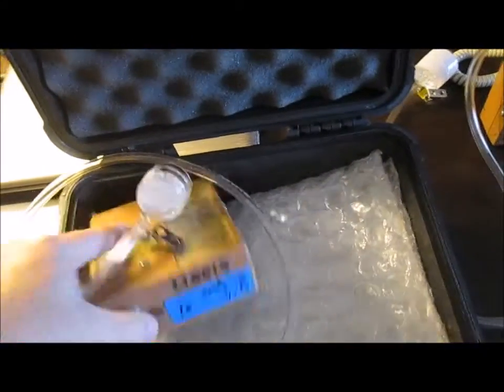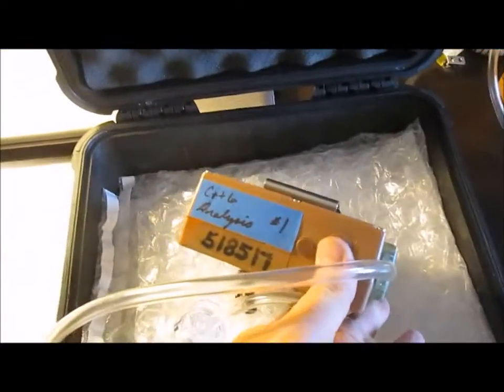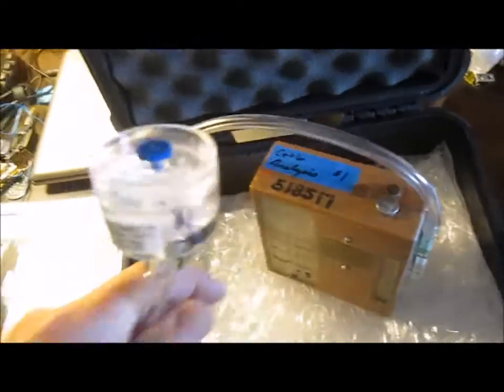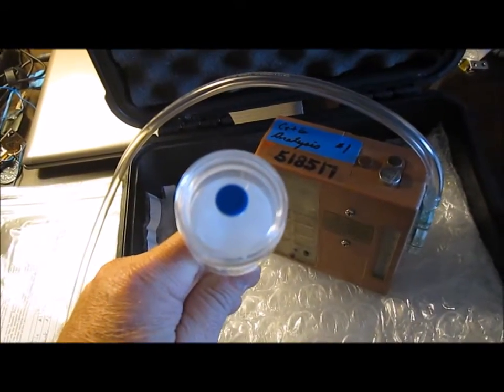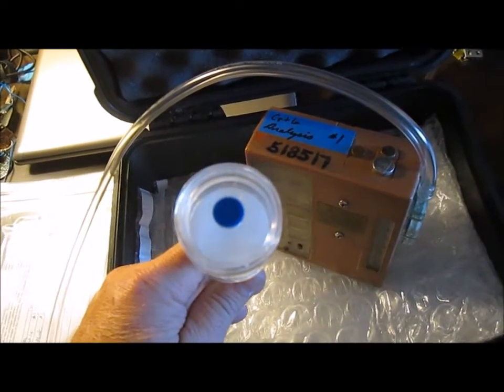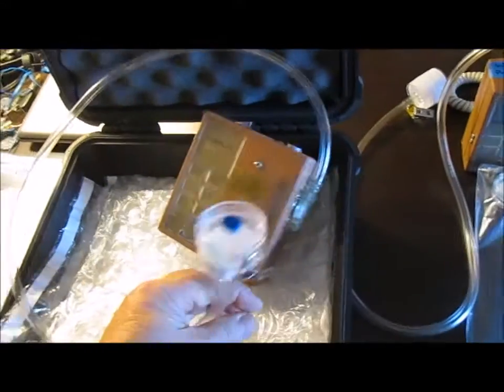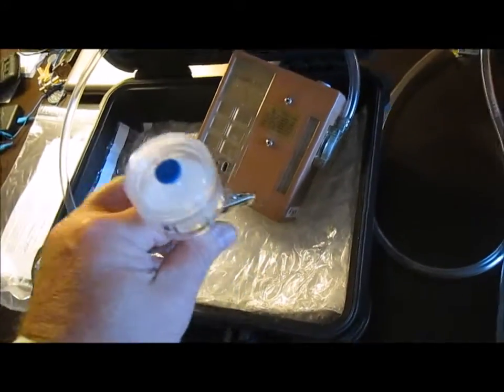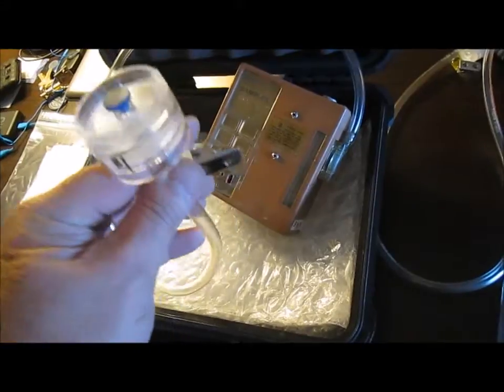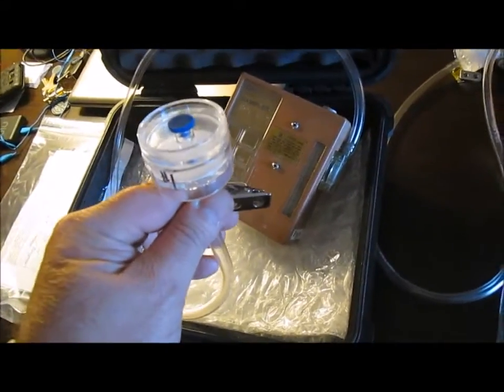This pump is also marked and this one is CR6, which is hexavalent chromium, and this is the cartridge that it will use. I take the cap off of this one. These run for about 8 hours, or whatever time frame you want, but I usually do 480 minutes. I mark down the time I start and the time I end, then turn the pump off, take the cartridge off, and cap it.